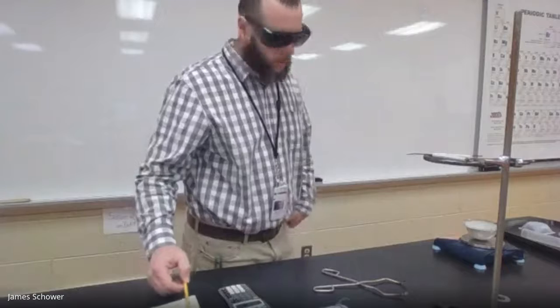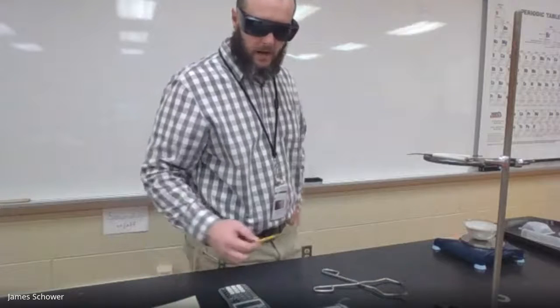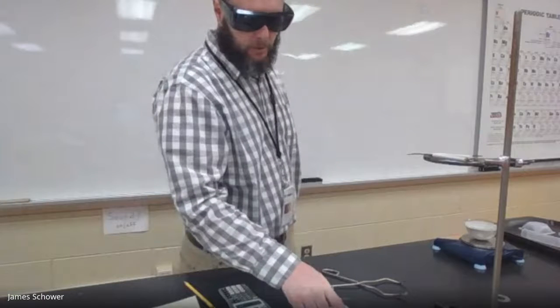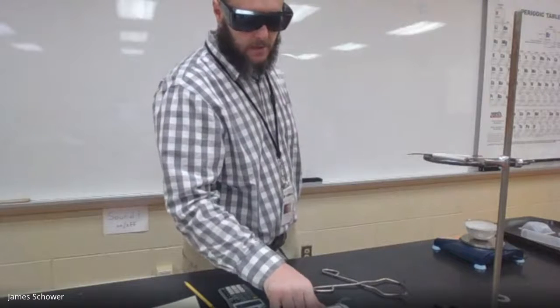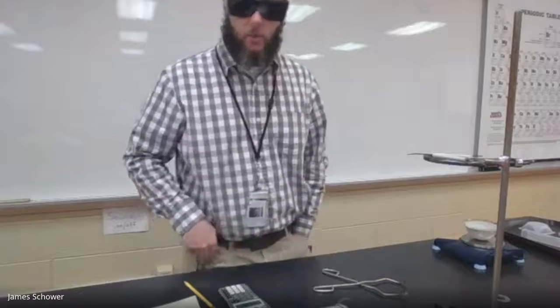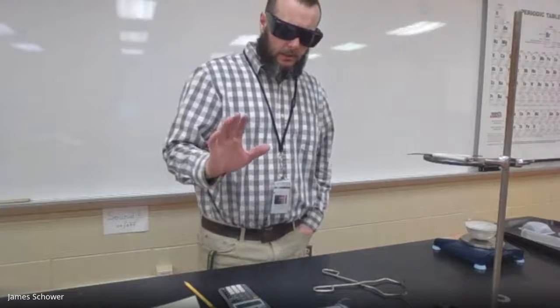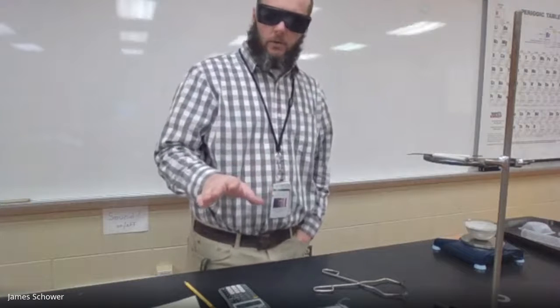And I got 126.07 grams. So that is the mass that's in the data table for number 3, evaporating dish, watch glass, and NaCl. Again, it's 126.07 grams. Now, let's look at number 2, because number 1, you were to do that already.